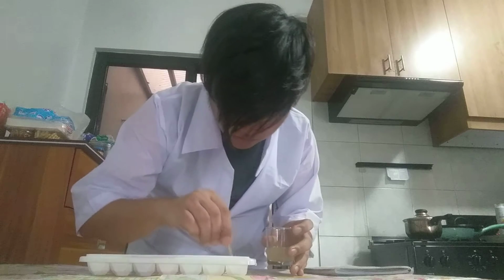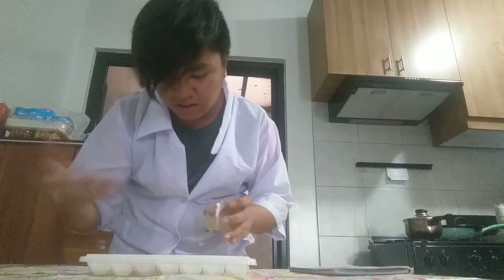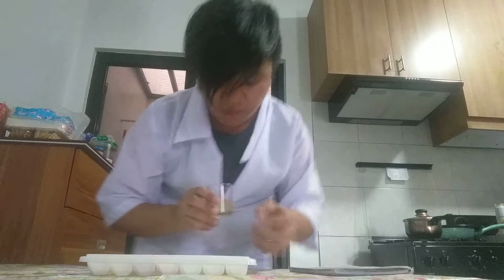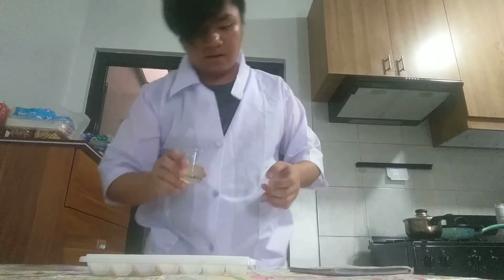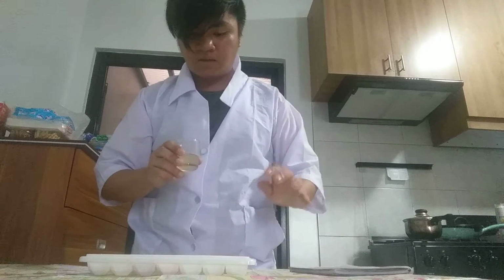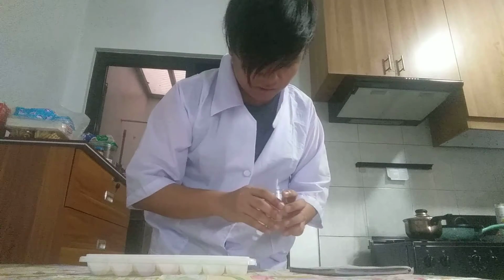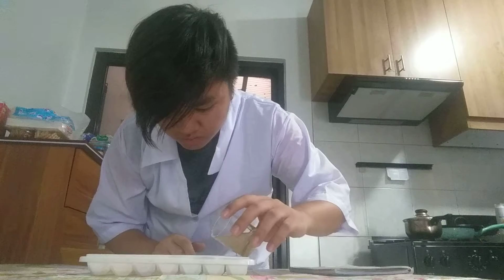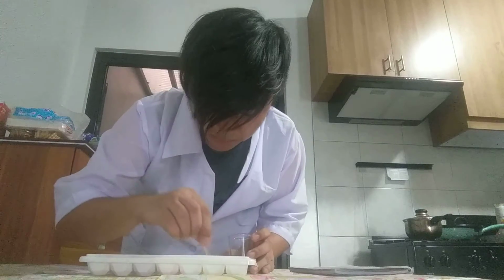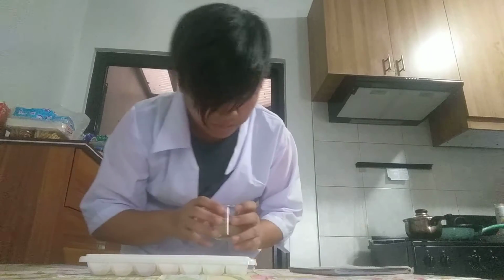Okay, for the baking soda, I don't think there's any reactions. It's just like pouring not enough water into a milk, and nothing happened. It's like the baking soda is on the bottom, and then the carrot juice is above that. Okay, so next up, the tomatoes. Like what happened on the other materials, it became a transparent color.